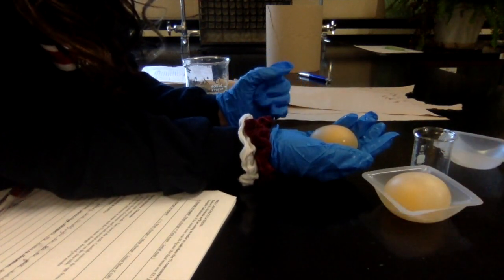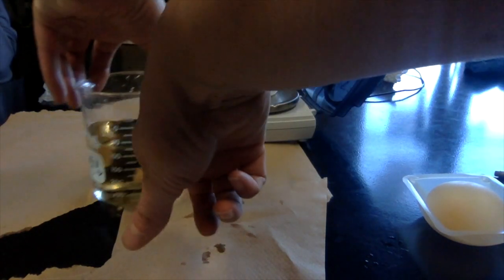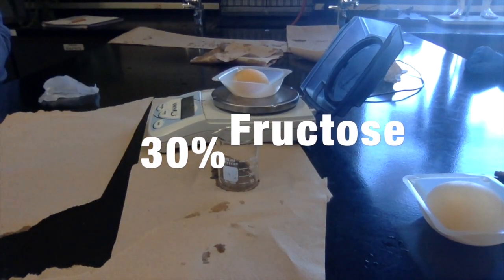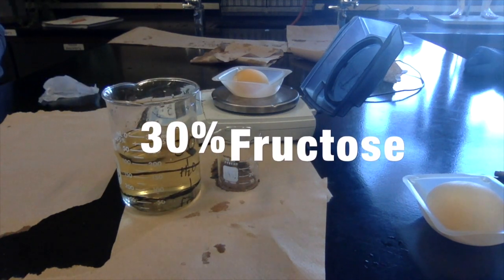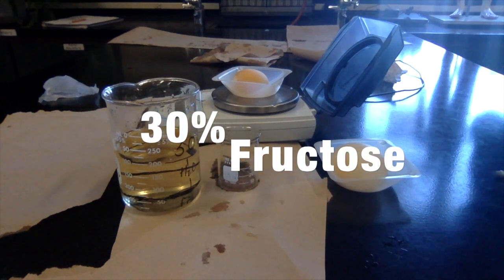So why don't you mass out, so you can just talk about the viscosity. What do you notice? So that was the line. That was the line where there was fluid, but now look at the line. So there was more solution, so stuff came out of the egg and kind of filled up the water a little bit. Exactly. Nice job.